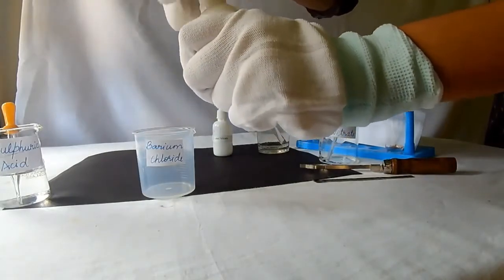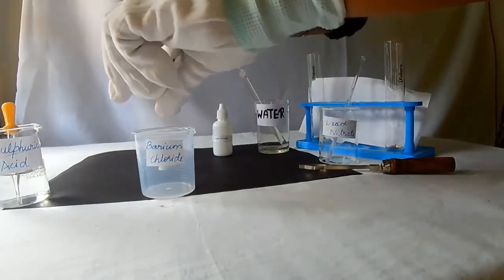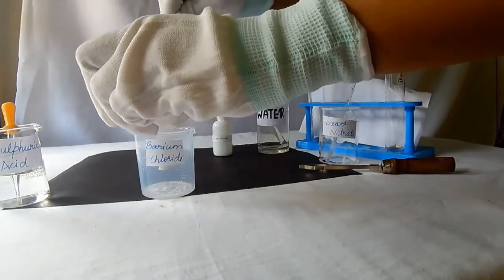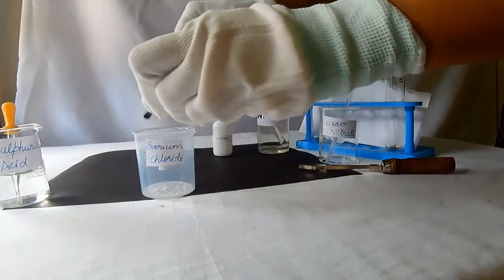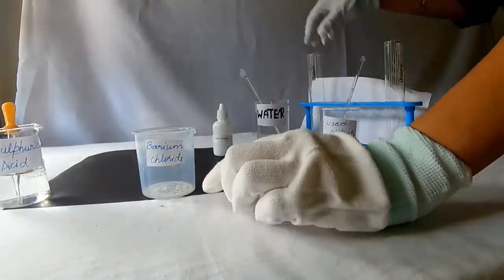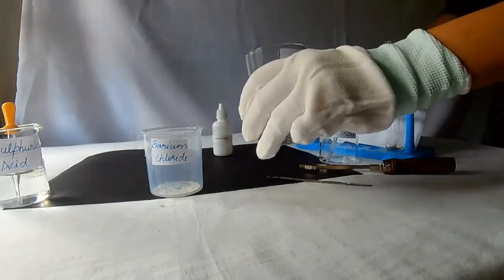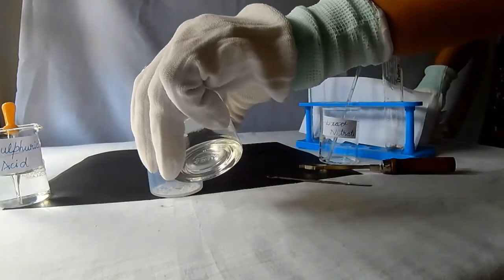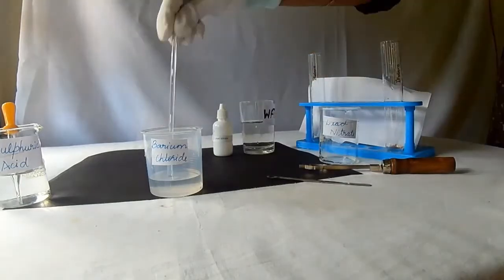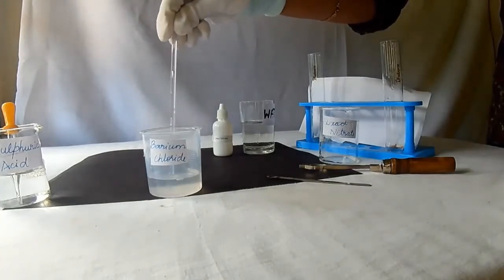Take barium chloride salt in a beaker. Take a very little amount of salt. Now the salt is ready. Add water to the beaker and prepare the solution of the salt. Mix the salt well in water using a stirrer.